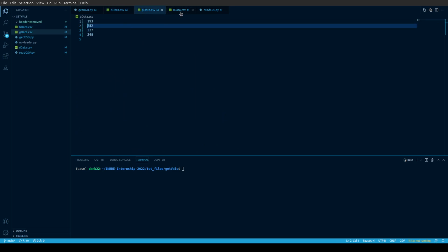We have some CSV files with some data in them. At this present time, I don't have any guard code to not erase the file when we begin a new run of this particular program, but rest assured, it's going to come in later. This is all in testing phase right now. So what it's going to do is erase these values instead of preserving them. In the future, we're going to have a way for you to store the calibration from last session or begin a new calibration based on your imaging, because not all images are equal and not all color channels are used, I guess, universally across the spectrum of the imaging that you're going to be dealing with.